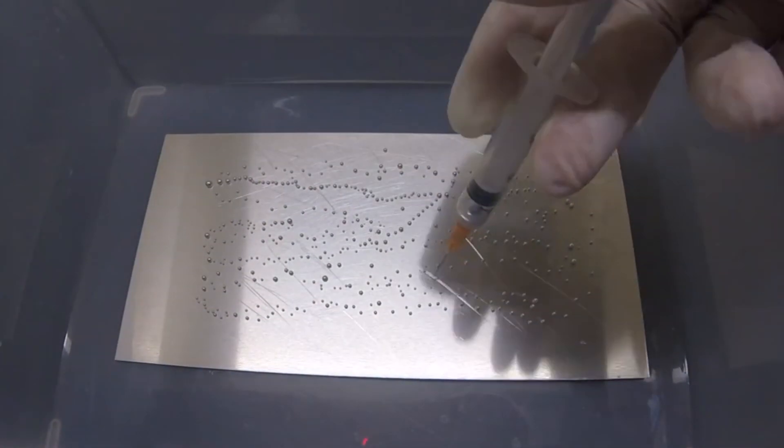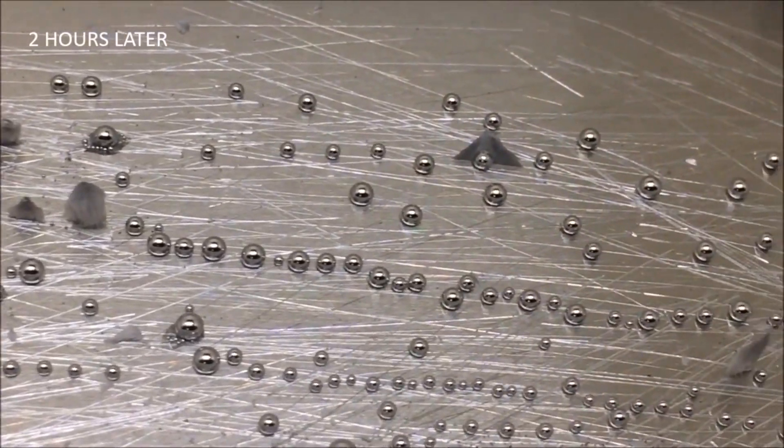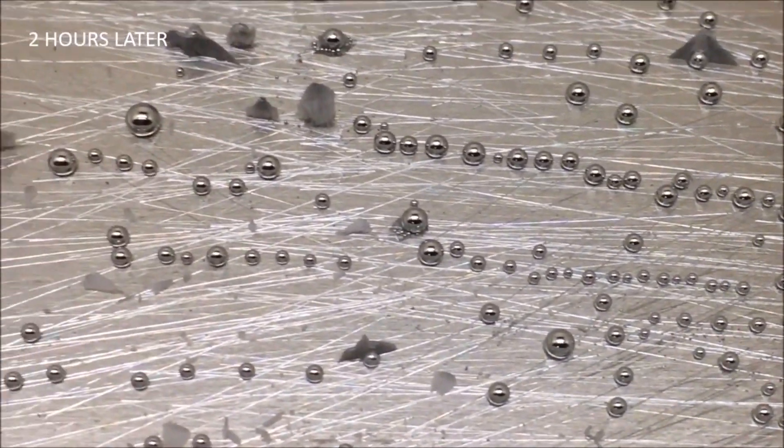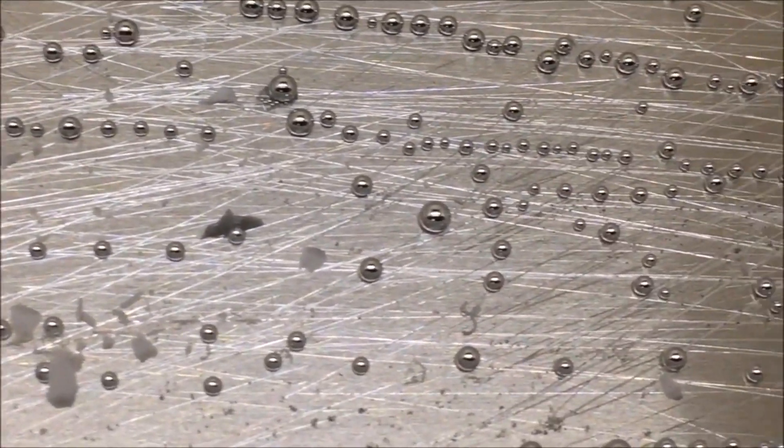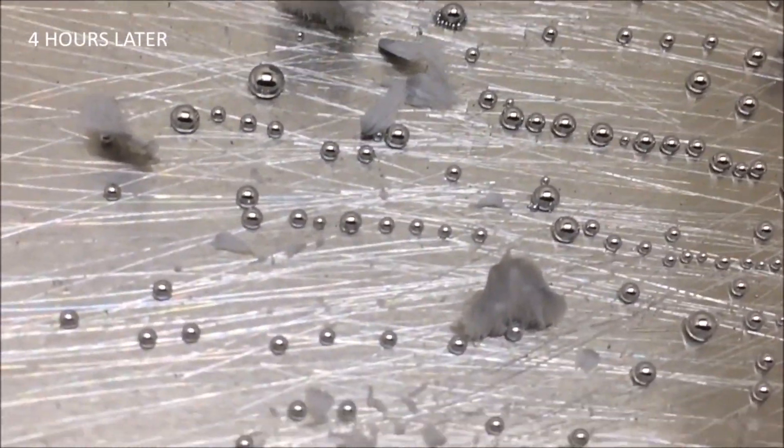Back in July 2017, I uploaded a video of me applying mercury onto a plate of aluminum, and something really interesting happened as there were mysterious fibers growing from the metal plate.